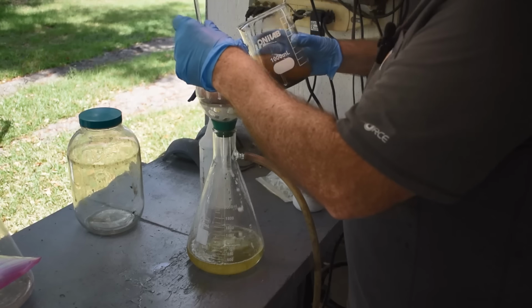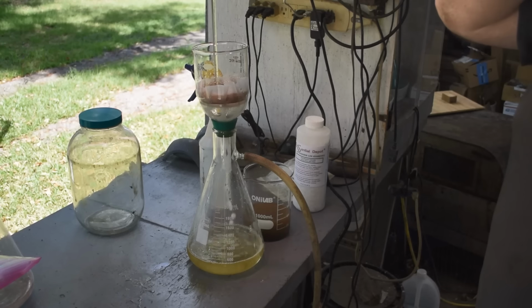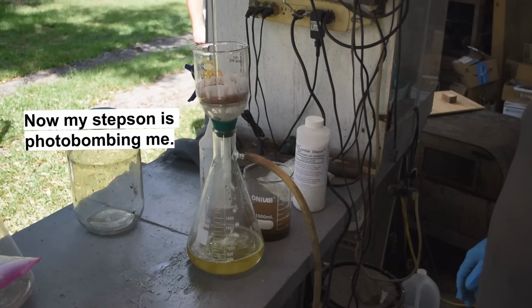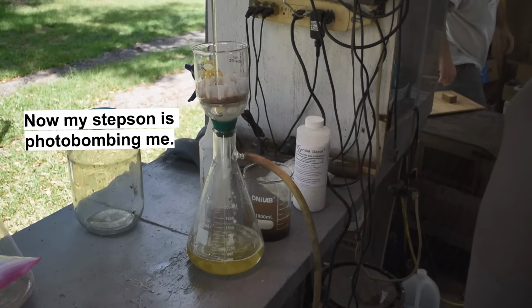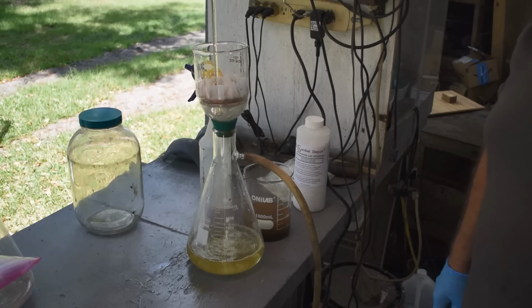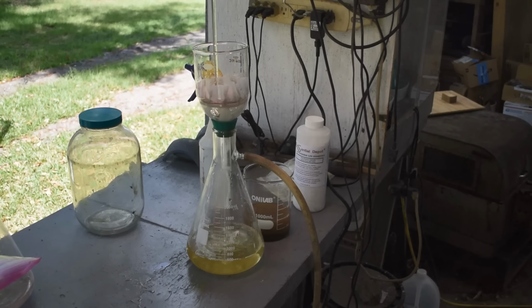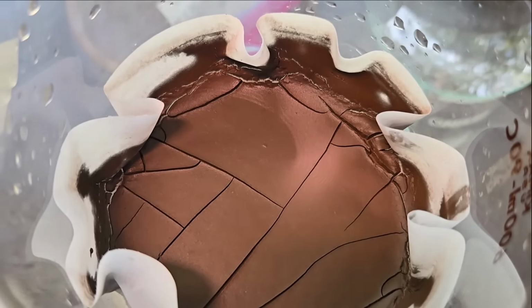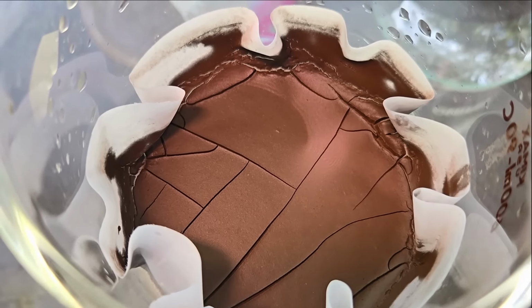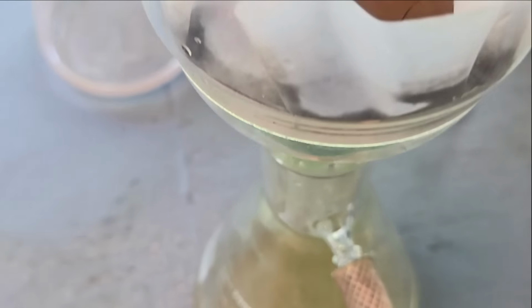So I'll get all the liquid through first, and then once I pour the solids in, things are going to slow down. I'm going to take the first batch of liquid I filter off and put it back in the spent leach bottle for next time. And then we'll give some rinses to the solids once they're up in there. Get them cleaned up. So the solids are in here now, and I've been pulling the leach liquid out of it. It's drying up nice.